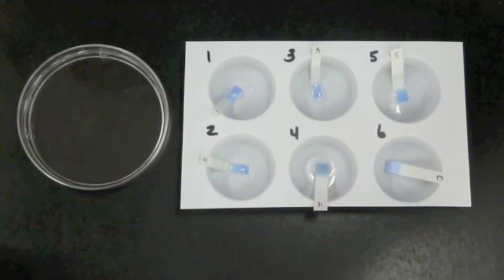The second part of this lab is going to require us to take our soaked strips and place them in a mixture of alcohol and vinegar. This is called a developing solution and will help us to see if each of the liquids contains protein or not.